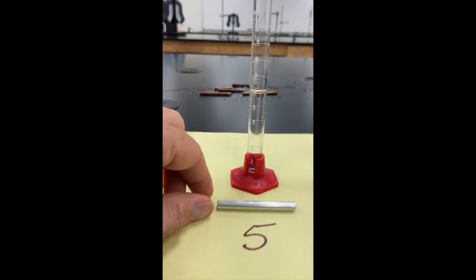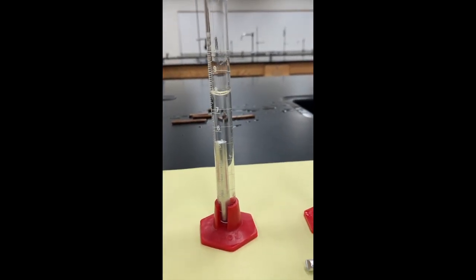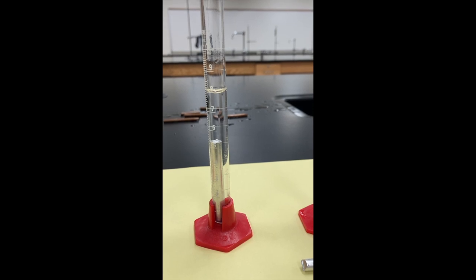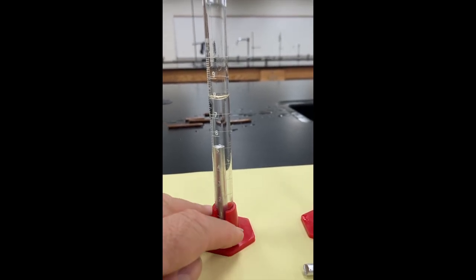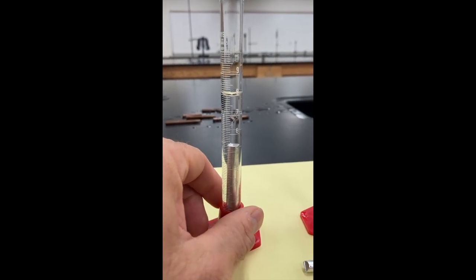Now we're over here at piece five. We'll put that in, let the bubbles come to rest here, and let's see if I can turn this a little bit to give you a better look at the lines.